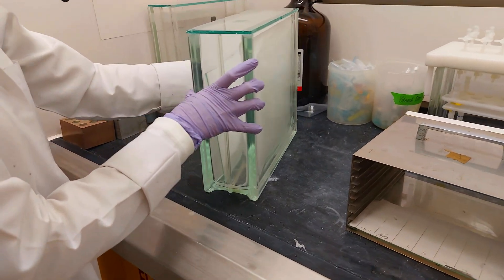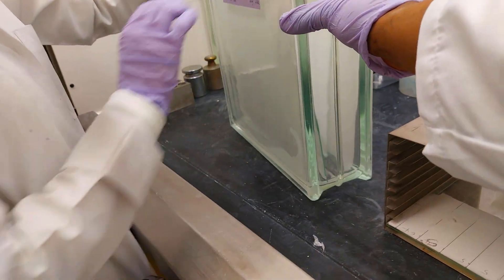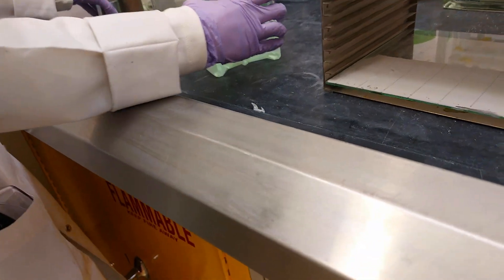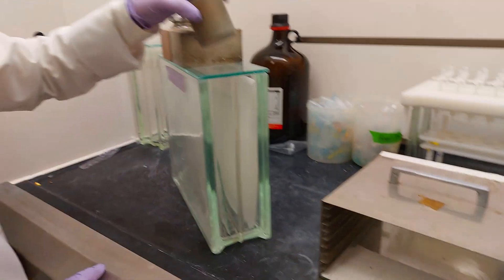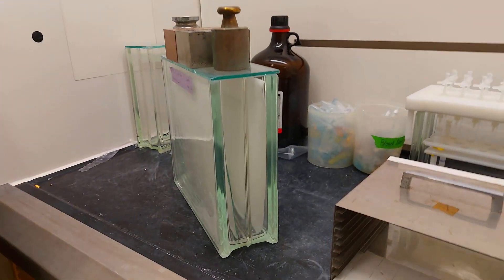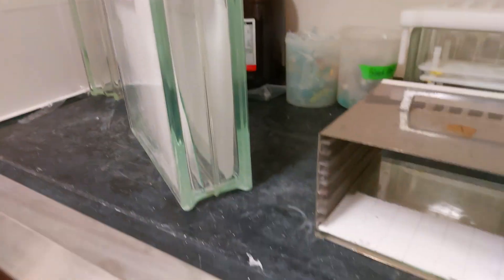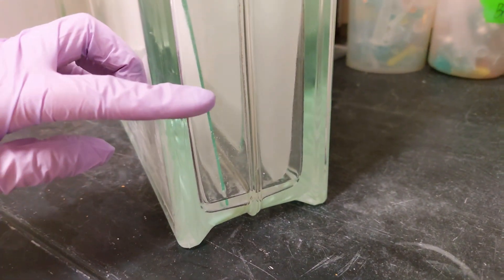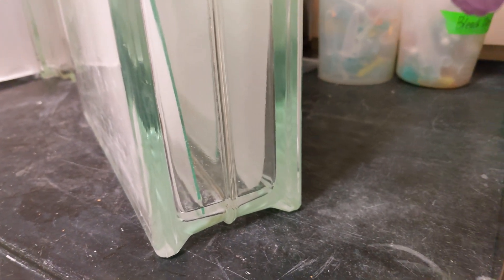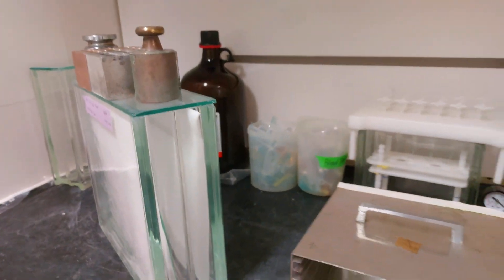Just cover them up. We can see it from here — the solvent level is very low right now, but we can observe it. We just have to wait; sometimes the solvent front goes up to about here, and then we can take the plates out.